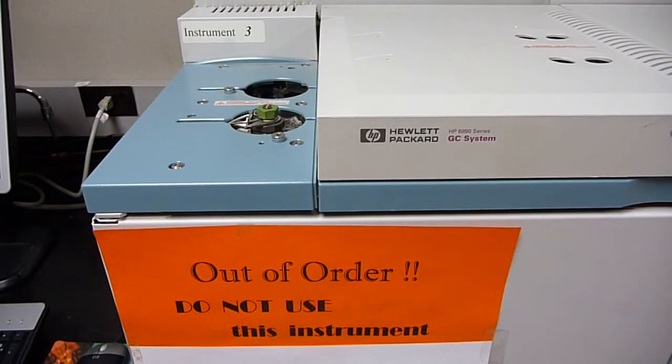After 18 years in use, one injects the sample into the GC and, lo and behold, you discover the oven in this GC no longer heats. This video deals with that repair.